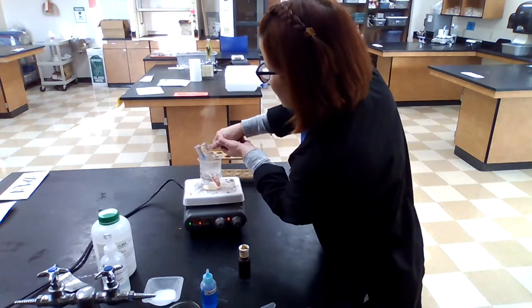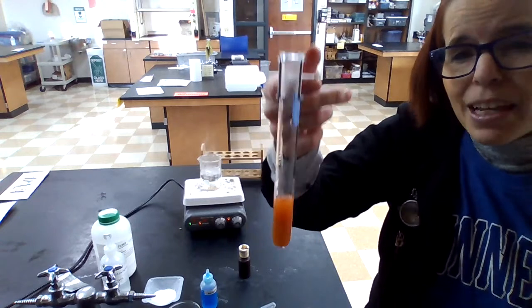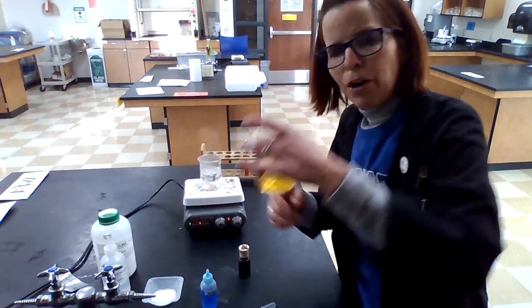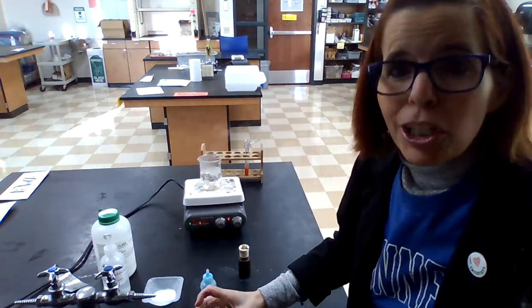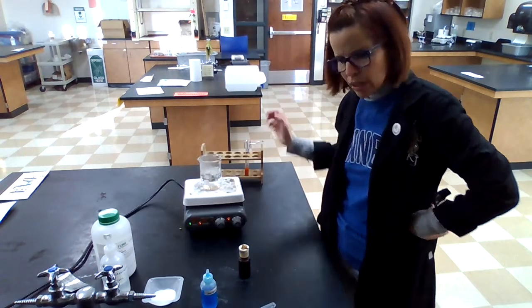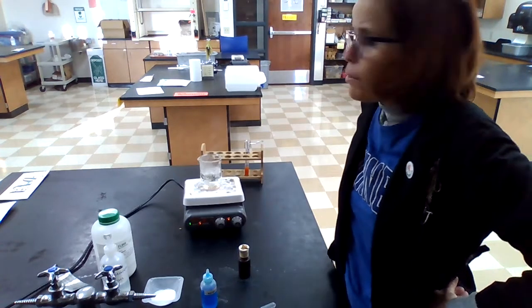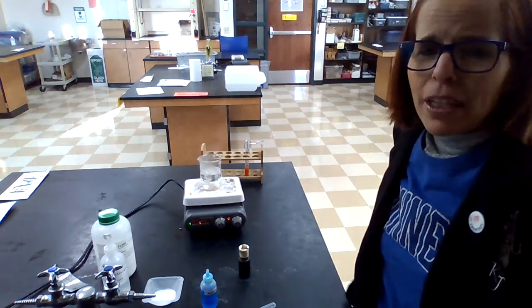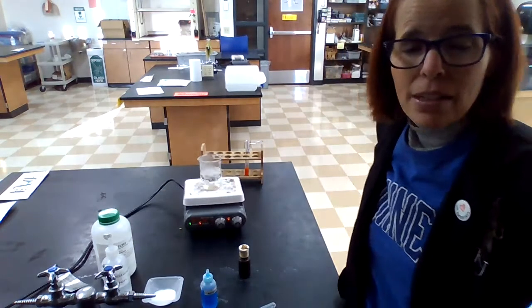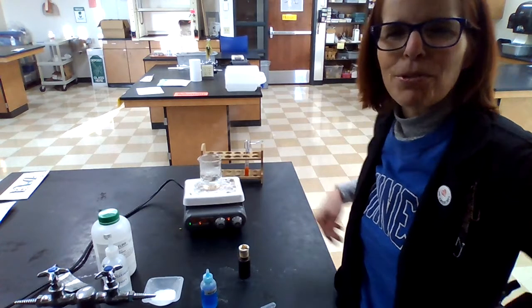I see a vibrant color change here — it went from blue to bright orange. That's a positive test for sugar. We tested on the outside and discovered that sugar did escape out. But the iodine showed us that starch did not escape. So that tells us that sugar was small like a ping pong ball and starch was big like a basketball. The larger molecule must be starch, because it was trapped inside and wasn't able to pass through the tiny holes in the semi-permeable membrane, but sugar could pass through.